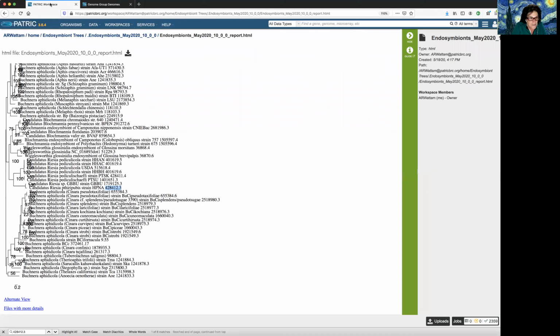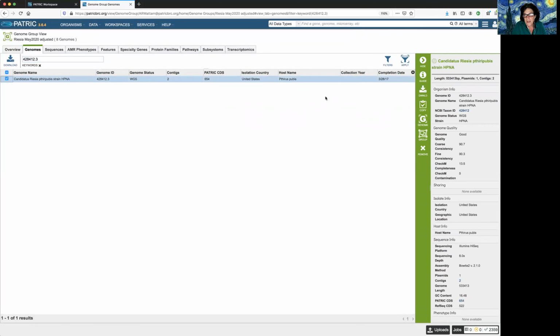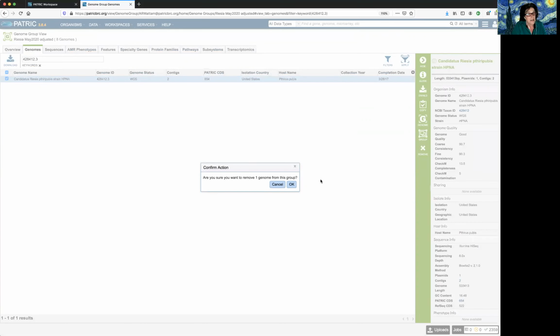Let's just verify that, HPNA. So now I click on this checkbox immediately to the left of the name. The downstream functions include remove. So let's get rid of it. And I click on that and it asks me, it wants to make sure I'm sure. Yes, I want to get rid of it.